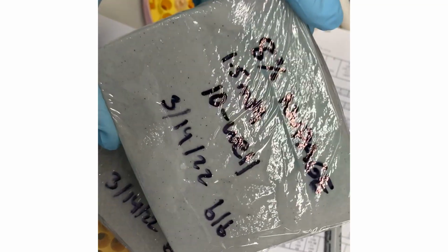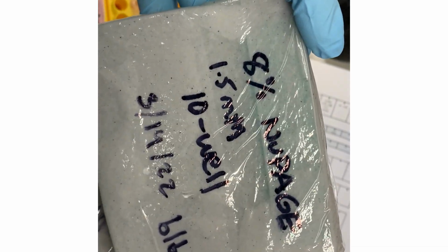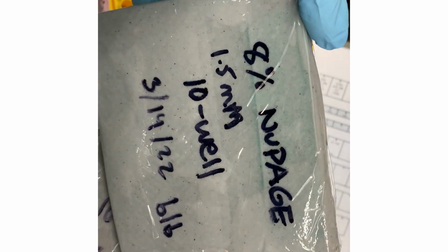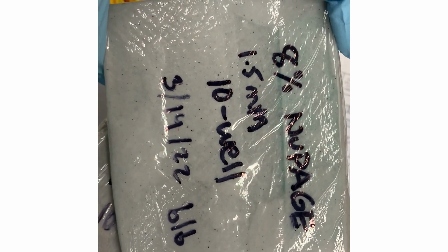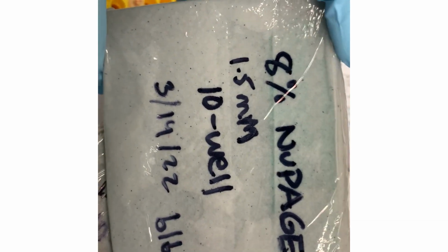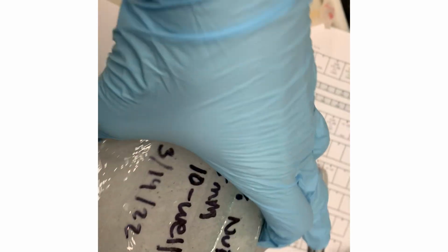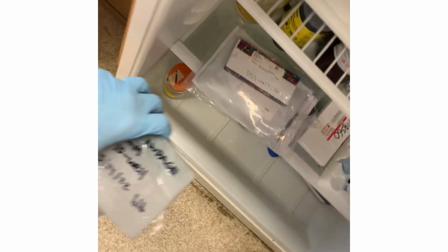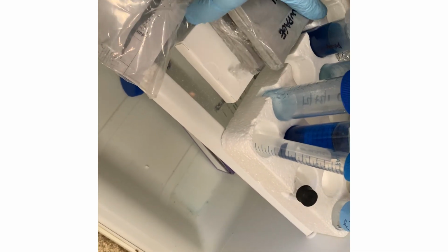And I'm going to label them. I label them with the percentage and the type of gel it is, NuPAGE. There's also tricine, tris-glycine, a bunch of different types, but this is the NuPAGE formula. Then the thickness and number of wells, date, and my initials. And now it is off to the fridge. These can actually last for quite some time. The bigger problem is that you can get mold growing on the paper towels, which is gross.